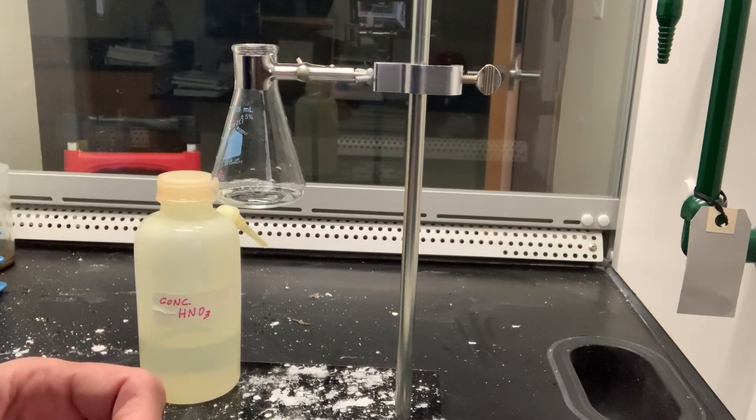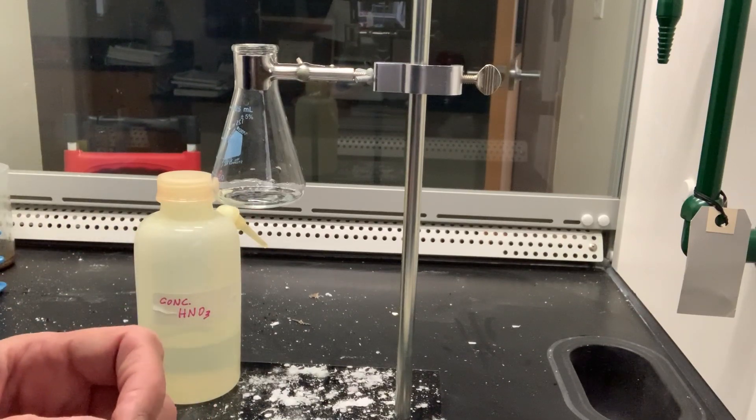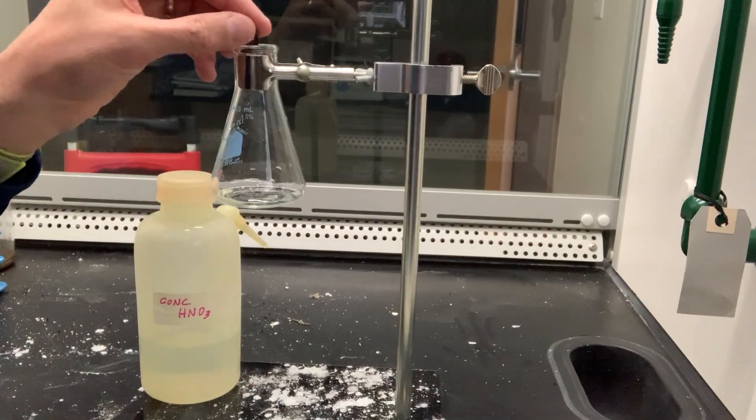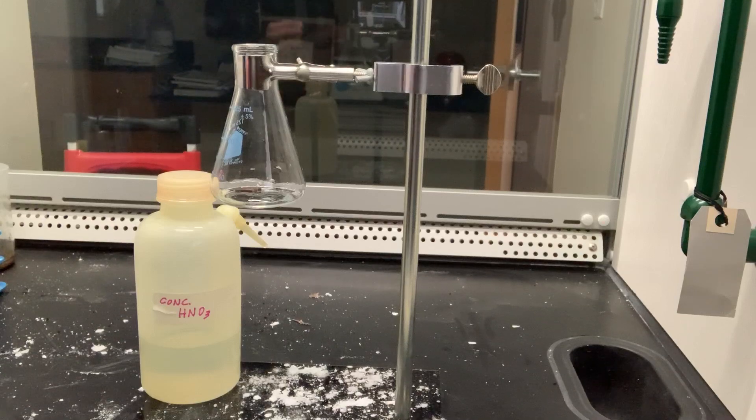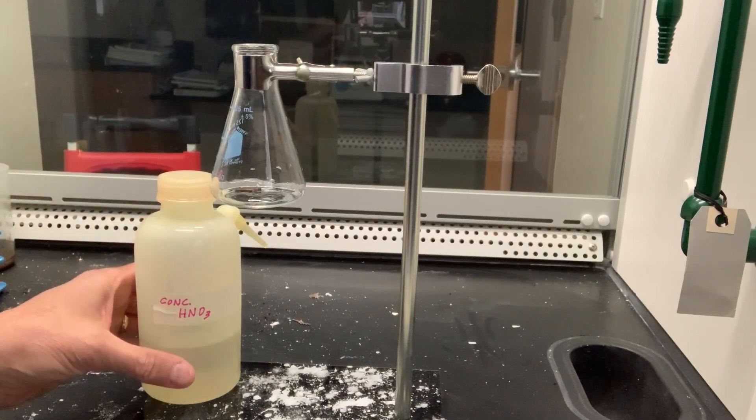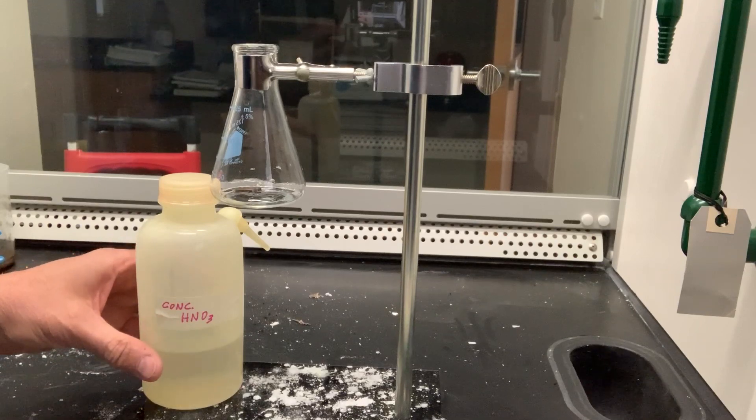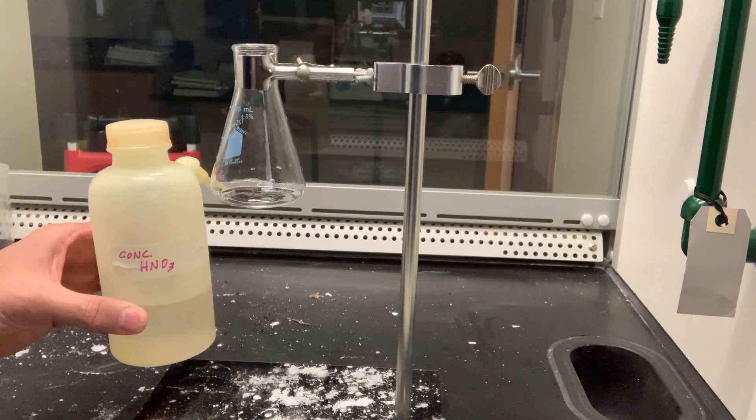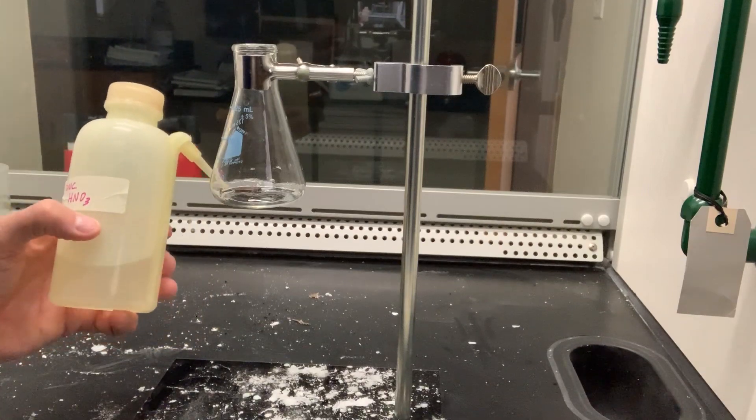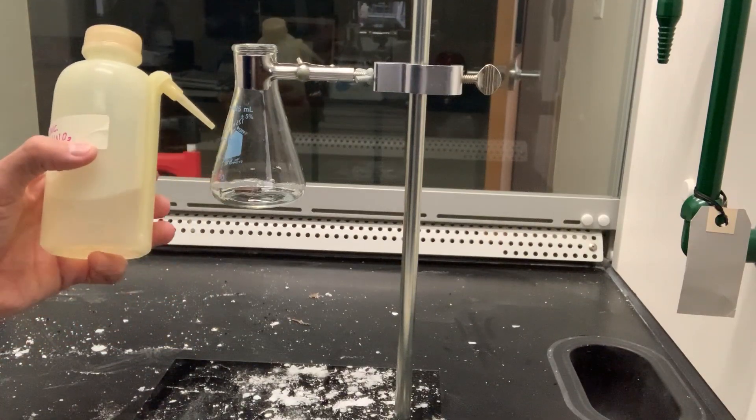I had seen a bottle marked nitric acid on a table in the doctor's office, where I was then doing time. I did not know its peculiarities, but I was getting on and I was likely to learn. The spirit of adventure was upon me. Having nitric acid and copper, I had only to learn what the words 'act upon' meant. Then the statement 'nitric acid acts upon copper' would be something more than just mere words.